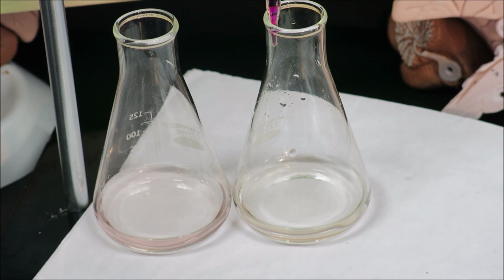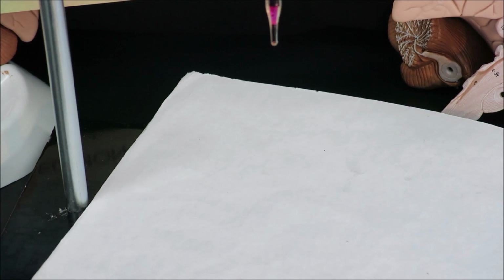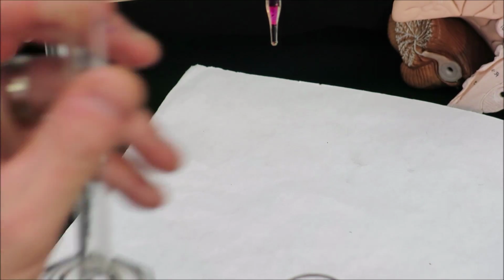We'll go ahead and read the burette. And in this case, we are again exactly at 34.0 milliliters. So we've reached 34.0 milliliters, which means that for the second trial, we have also exactly 14.0 milliliters added in. This does not usually happen for titrations, but it may, depending on your patience and your accuracy in measurement.